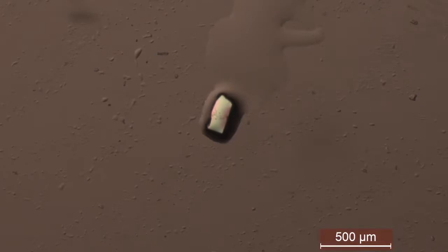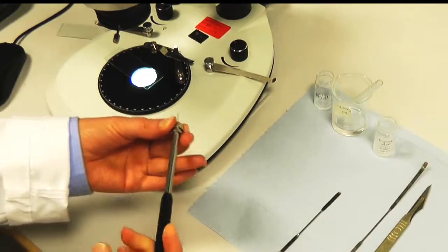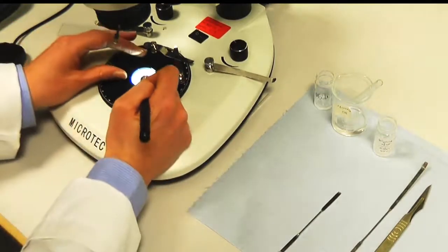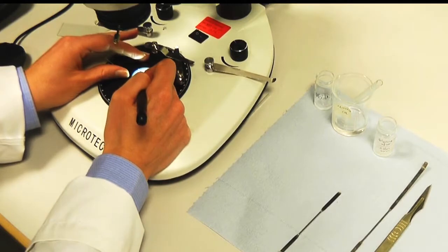The next step is mounting the crystal onto a nylon loop. This requires a scooping action and is made easier with the oil, which also helps with steadying the crystal on the loop.